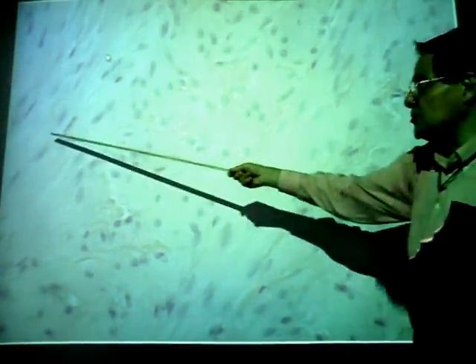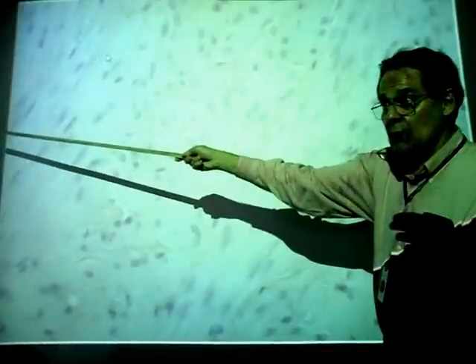Out here, circular smooth muscle. You can actually see there's a difference here. You don't have to use your imagination. Out here again, you're back to longitudinal. So, longitudinal smooth muscle next to lamina propria, a middle layer of circular smooth muscle, and an outer layer, again, of longitudinal smooth muscle. Like we saw on the wall of the urinary bladder.